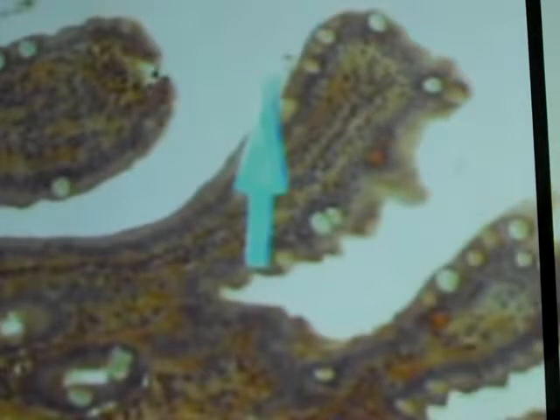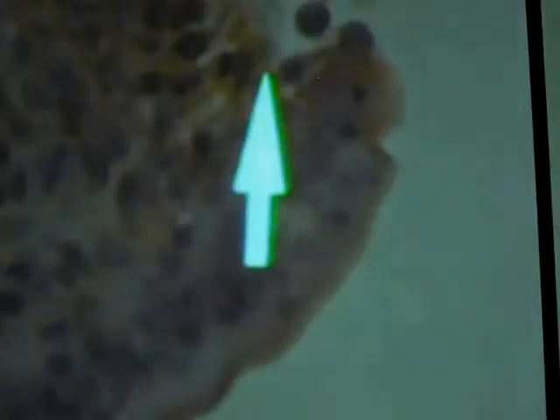In the small intestine, that's the main site for absorption of nutrients. The cells present in the epithelium are called absorptive cells. So we have our simple columnar epithelium, we have our goblet cells here, and then these other cells are our absorptive cells. It's hard to see the borders of the cells, but these are your absorptive cells here.